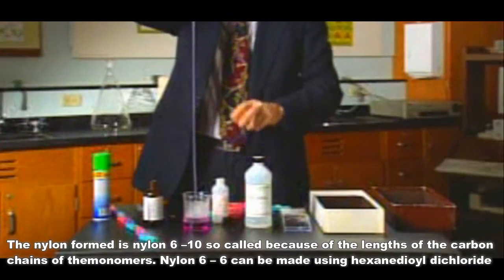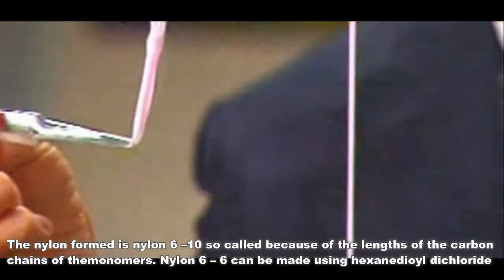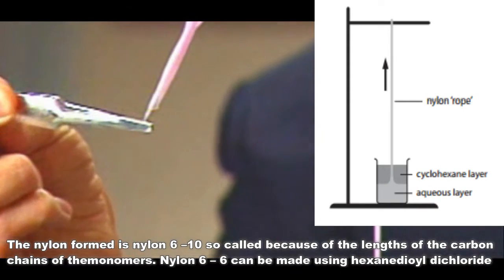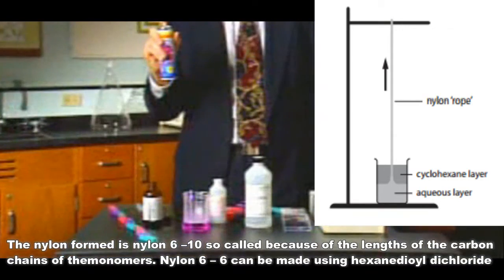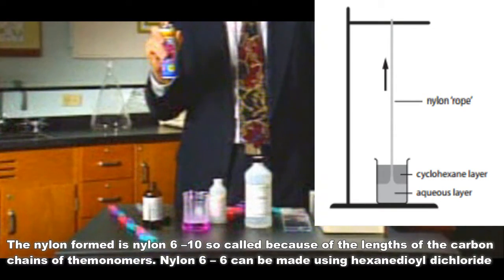This synthetic fiber, slightly colored by the phenolphthalein, is nylon. An application of polymerization can even be found in the toy store in the form of string confetti.